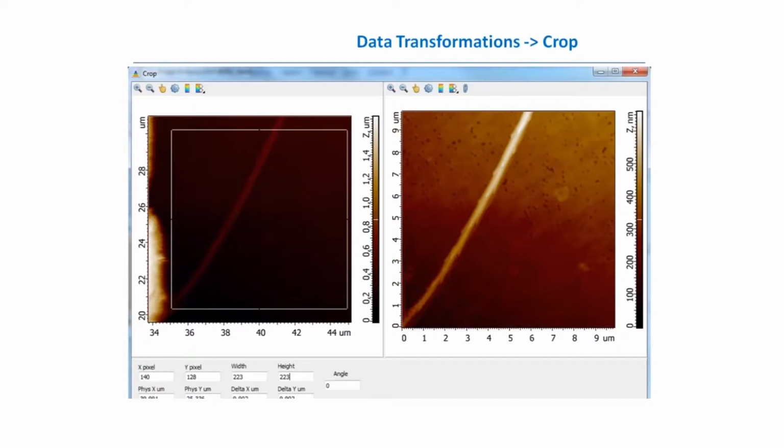In case you get a nice image, but at some area of your scan from the side you get some piece of dust or something that doesn't concern your result, we just cut it off. You can use the crop method where you can set the exact sizes of the crop rectangle and the exact position. And from the right side you see the result: we see our nice object without the dust from the left side.